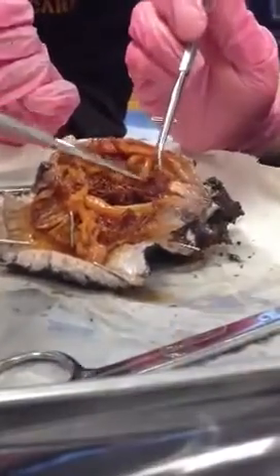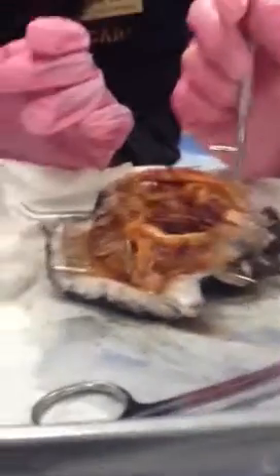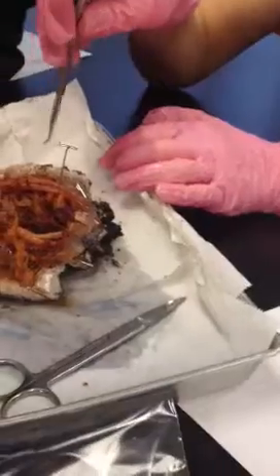What is this? That's the underside of the pharynx. Okay. I mean, I could really gross you out. If you shove that, the tentacles will really protrude out. Do it. We're okay. No, do it. The other thing that I don't see here that you're going to want to see is really what... Oh, this looks good. All right, sorry.